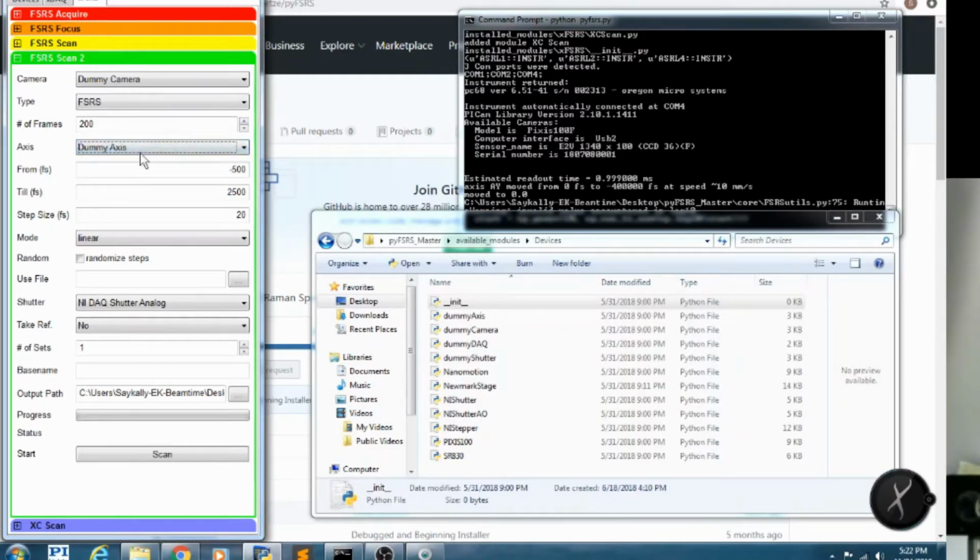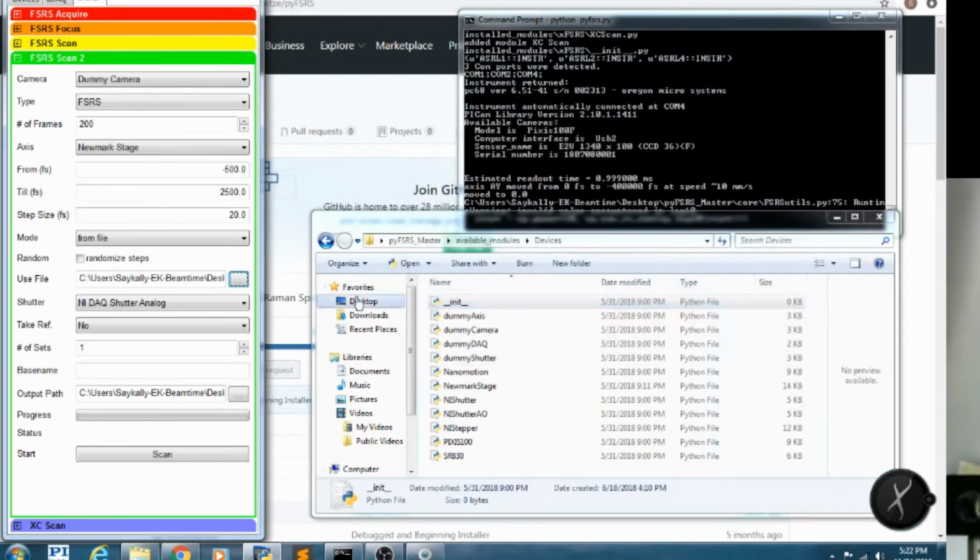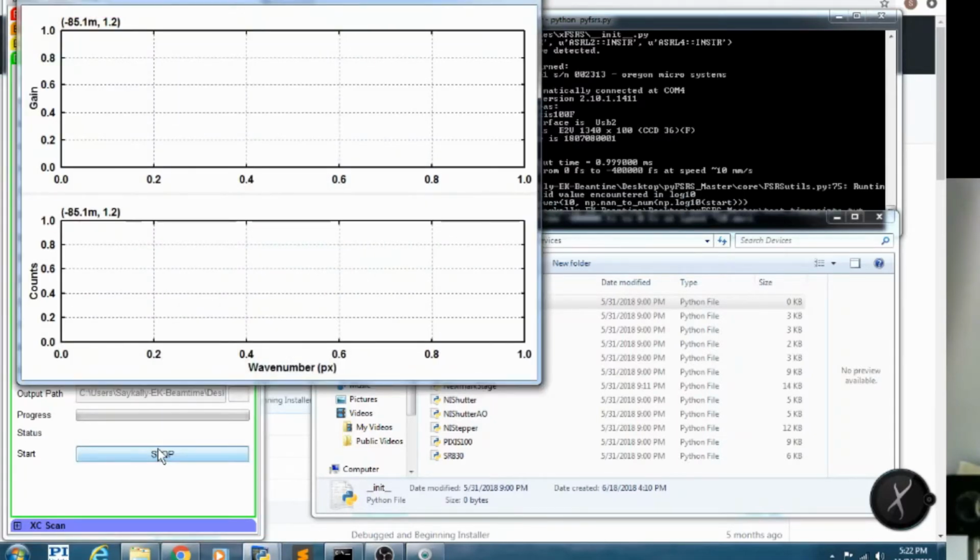And then we can choose which axis we want to sweep out. Here we're going to sweep out from negative 500 to 2500. Or we can load a text file, and I'll locate a text file here, test time points. Then I can also read out the lock-in every shot. And so what this would be used for is normalizing your laser. If you had an unstable laser, you could put the photodiode at a key point and then just make sure that your laser is being stable during the scan. Here I can tell it to run a base name of alpha 0. I can choose the output path.